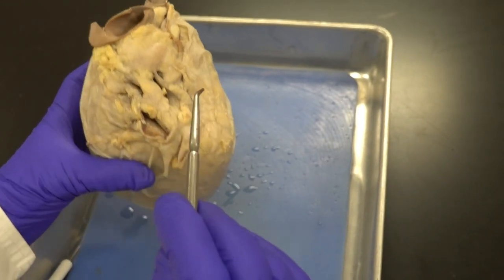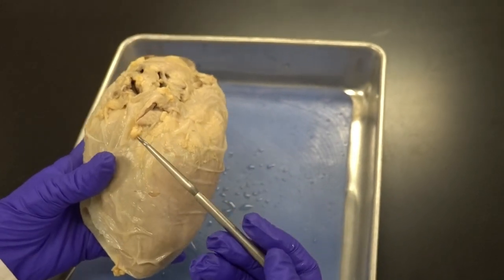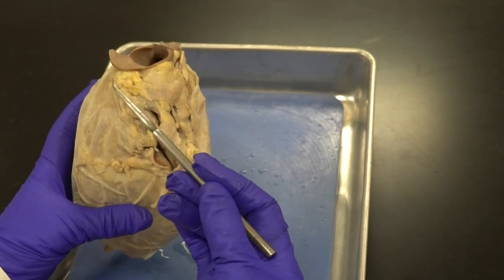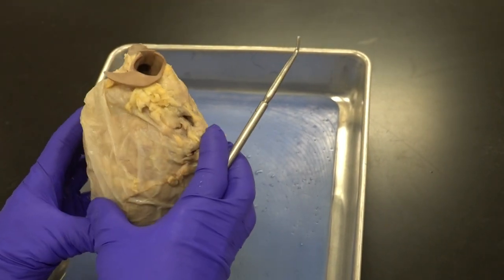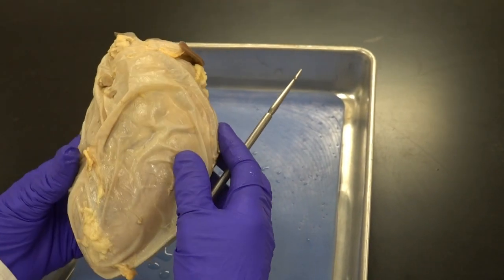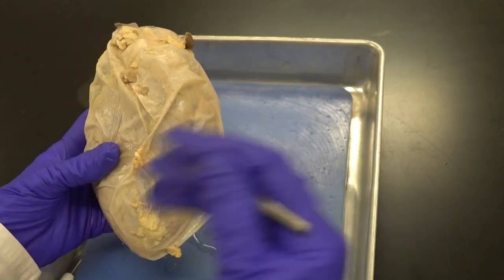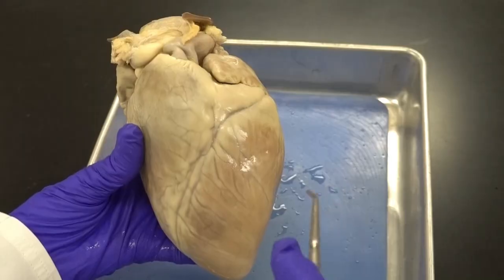Now I remove the fibrous pericardium. You'll notice adipose tissue in many different places — clearly this is for protection, serving as a cushion around an important visceral organ such as the heart.